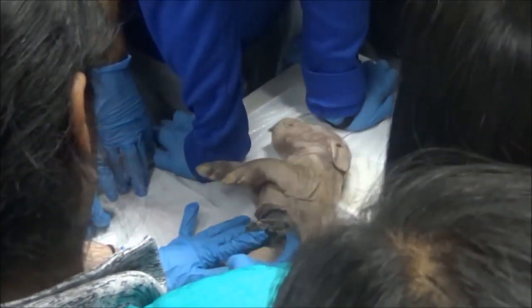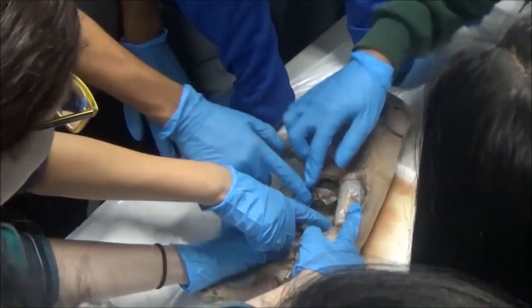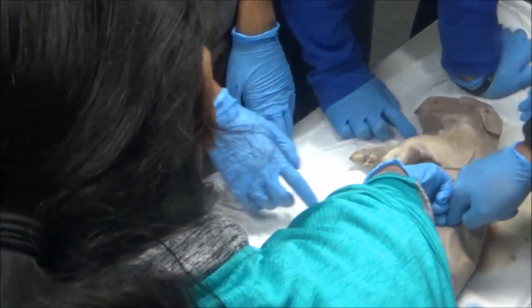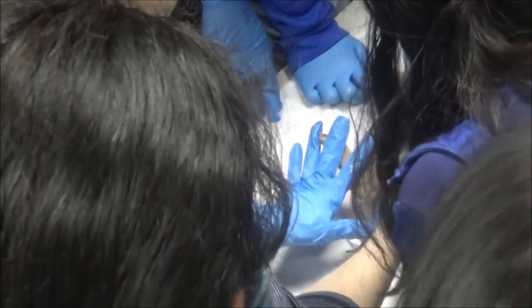If we look down here, that's the large intestine. It's much bigger than the small intestine — can we tell? Can we see the difference? How can you tell if it's male or female? You gotta look between the legs. That looks female to me, I believe. Are you sure? I will double check, because their bits don't look like our bits. Actually, it might be male — I will double check to make sure.